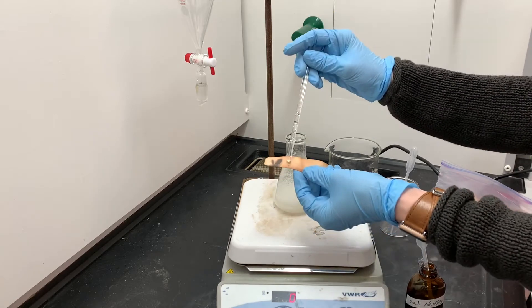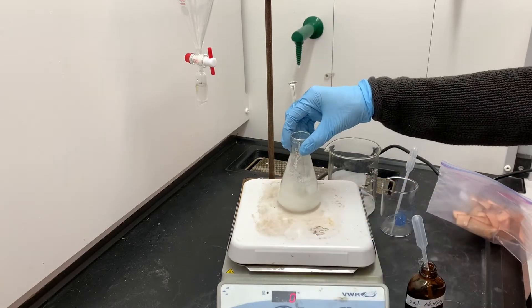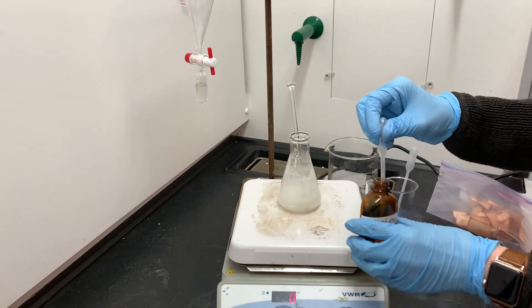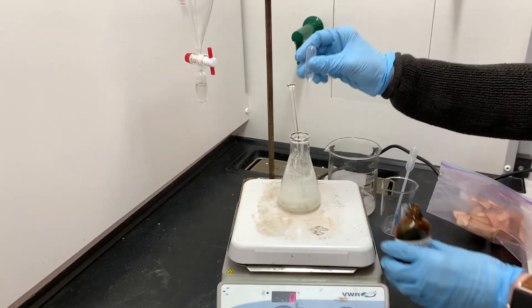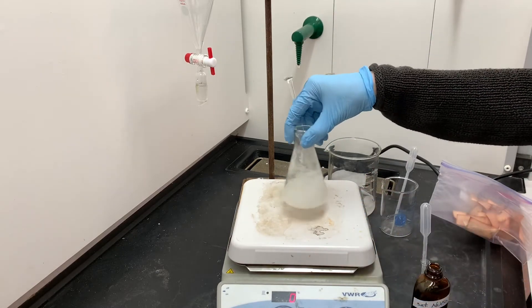And we will just add as much as it takes to get a negative test on the starch iodide paper. It doesn't matter if we have to add a lot. We'll be able to clean this solution up during the filtration process.